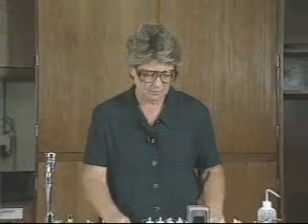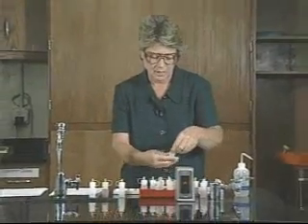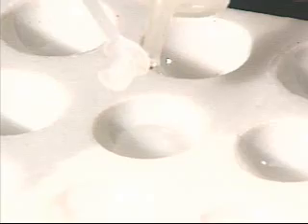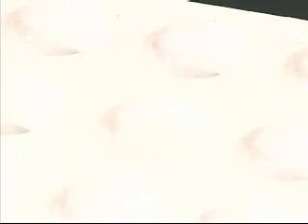Let's look first at the color change. I'll take five drops of a known anion in the well, and then add the reagents necessary for the test.